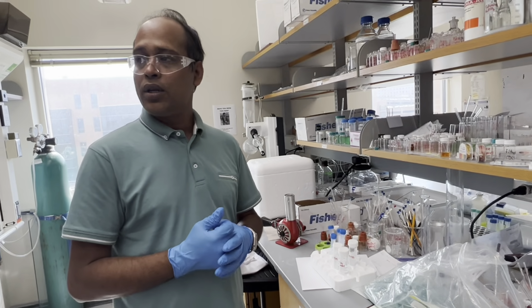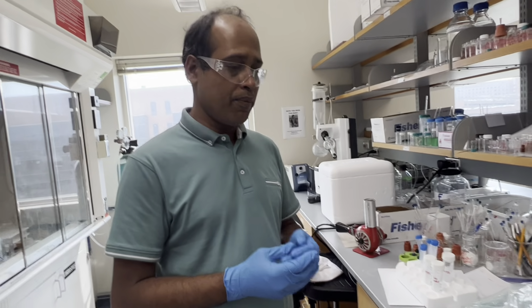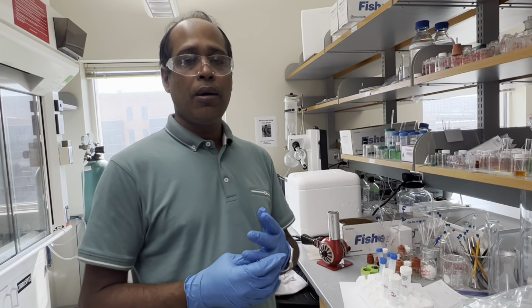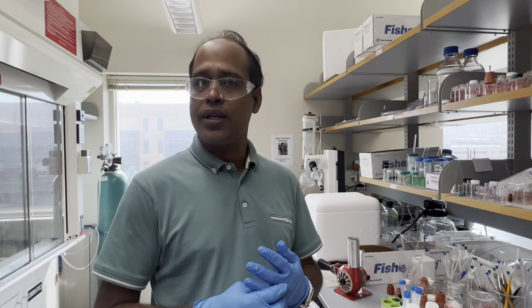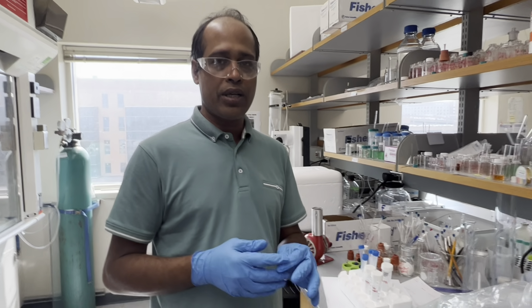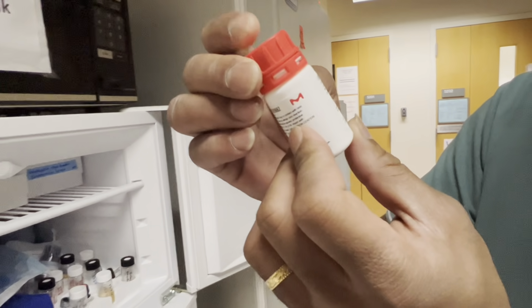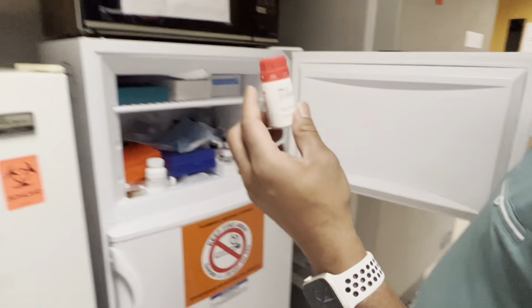And in the biosafety hood, not the cold room. It is important to do the bioconjugation in the biosafety hood, because otherwise if you do it open or outside, your bioconjugate will be attacked by bacteria or other contaminants. That's why we're so concerned about wiping everything; we have to clean up everything with the alcohol mixture. EDC is in the freezer. EDC always needs to be in the freezer. So we are going to use these.